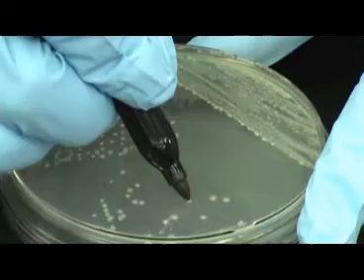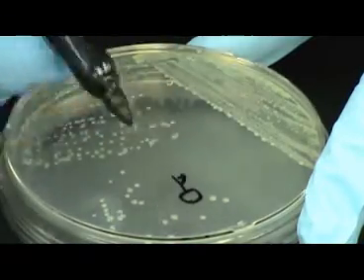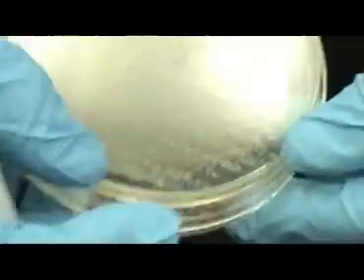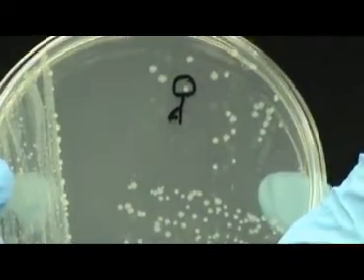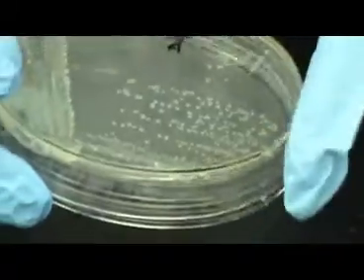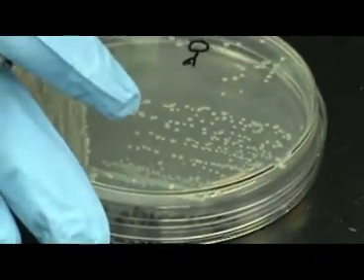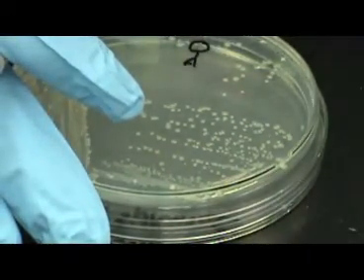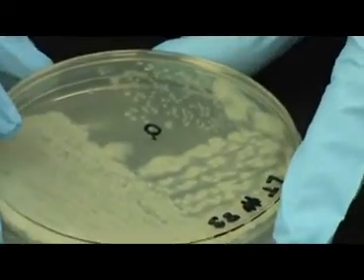When determining isolation, it is helpful to circle the colony that you wish to isolate. Since two organisms are growing together on the plate, you will want to label them separately. We suggest labeling one of the organisms A and the other organism as B.